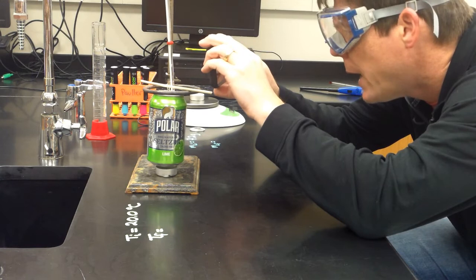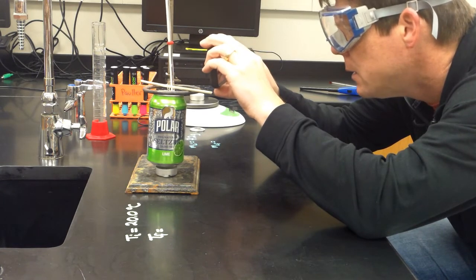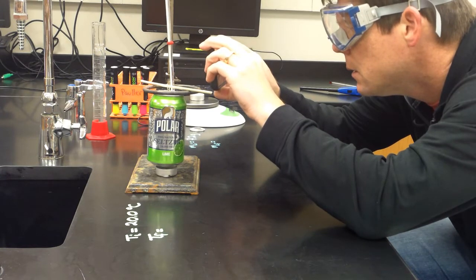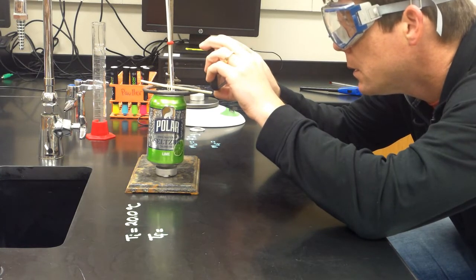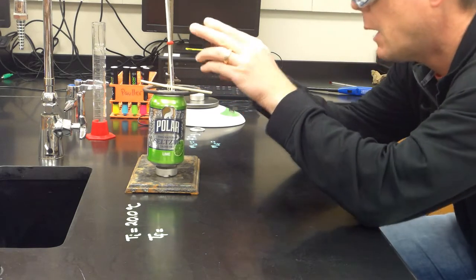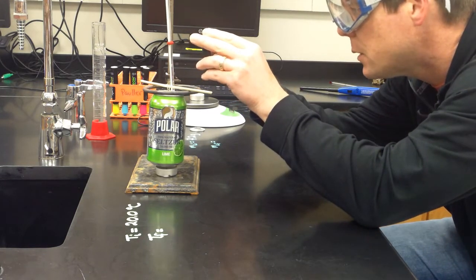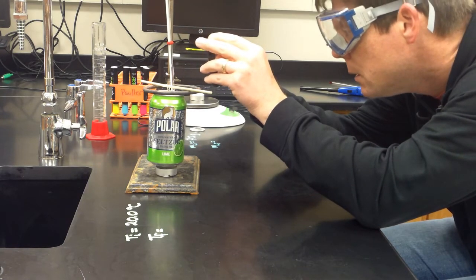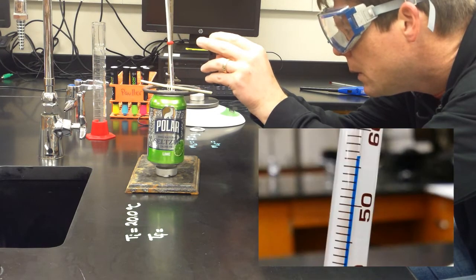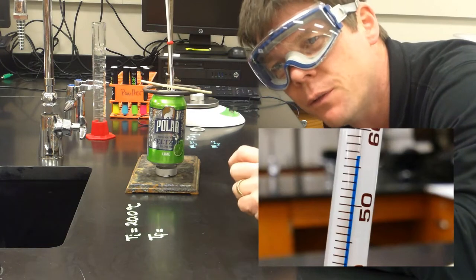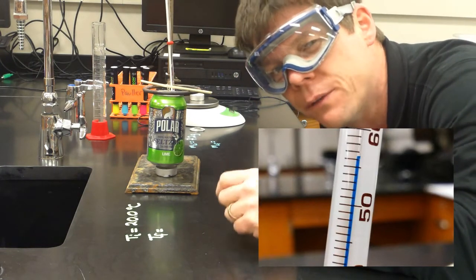Okay, so right now the temperature of the water in the can is measuring 56.8 degrees. I'm going to continue to watch this for just a little bit longer. Okay, it's still going up a little bit. It looked like it actually was at a temperature of 56.5 degrees.